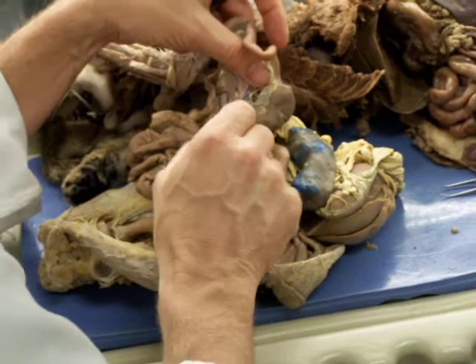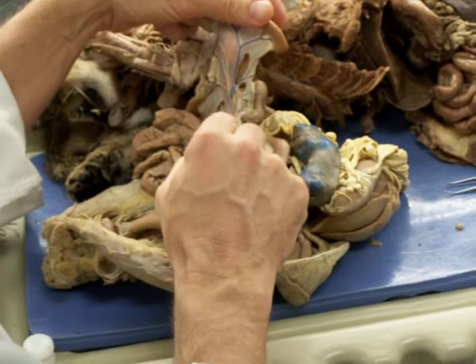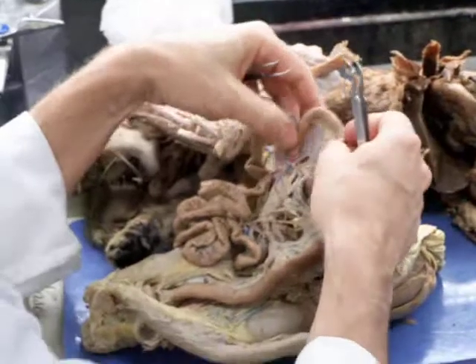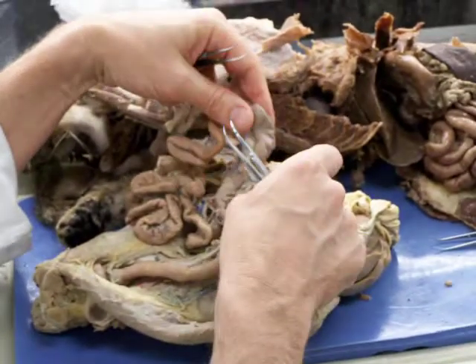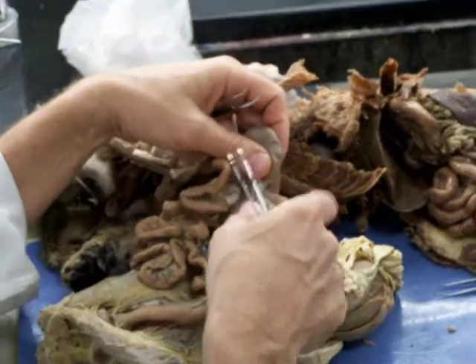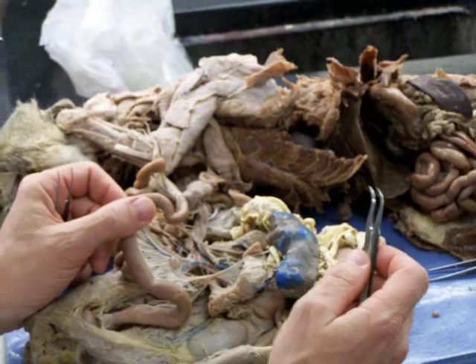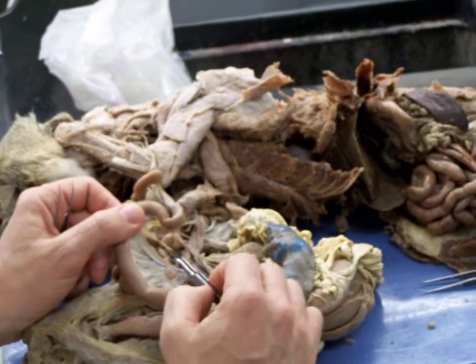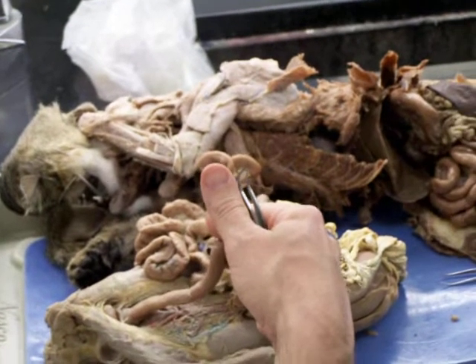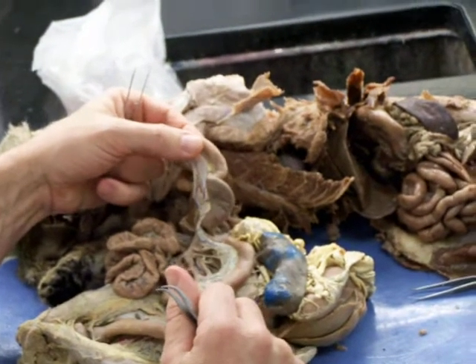And this probably, in the cat, this is all part of the jejunal artery, which comes off that cranial mesenteric. In the raccoon, there's kind of an anastomosis, and so the jejunal continues all the way down into the cranial parts of the colon and meets up with the ileocolic. In the cat, I think they're a little more separate. The ileocolic is going to distribute to the cranial portions of the colon and the terminal portions of the ileum, or small intestine.